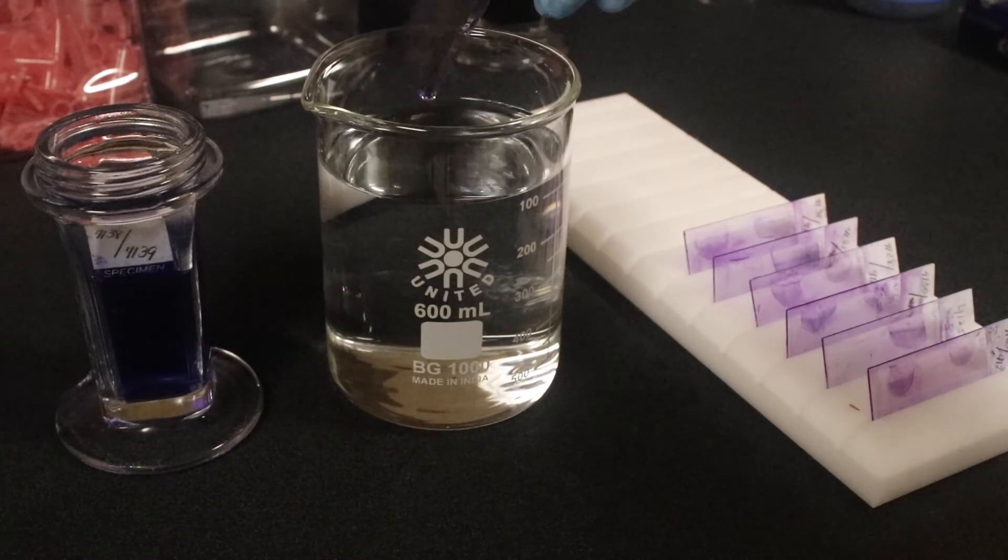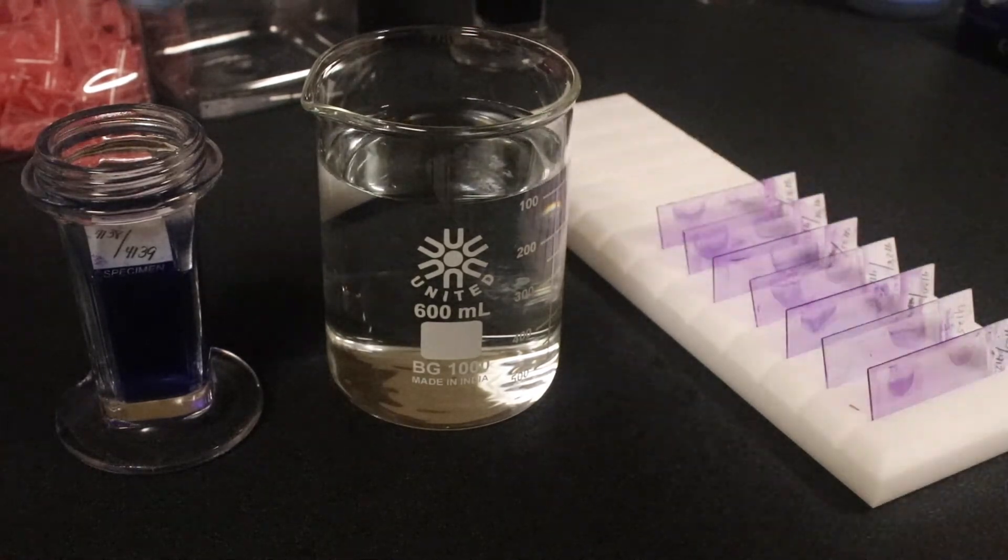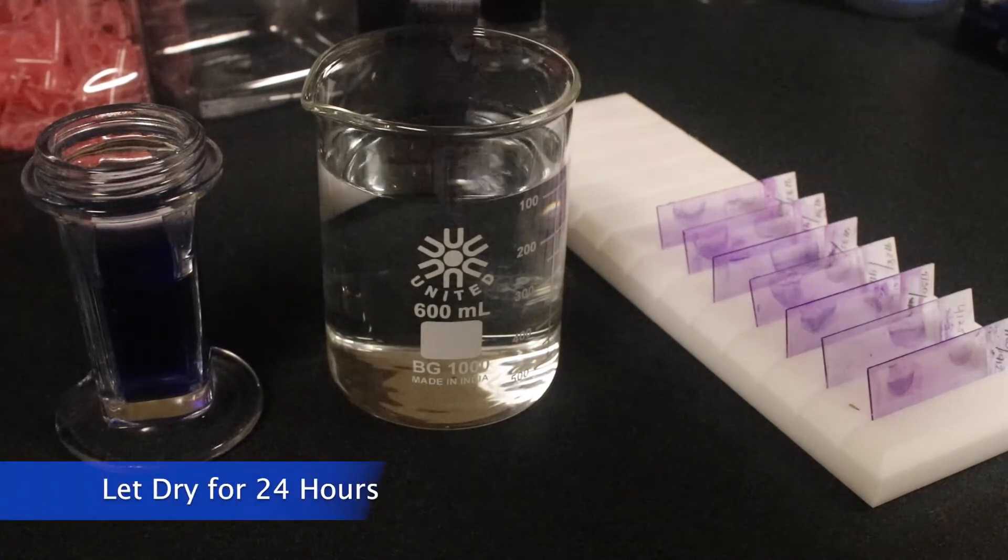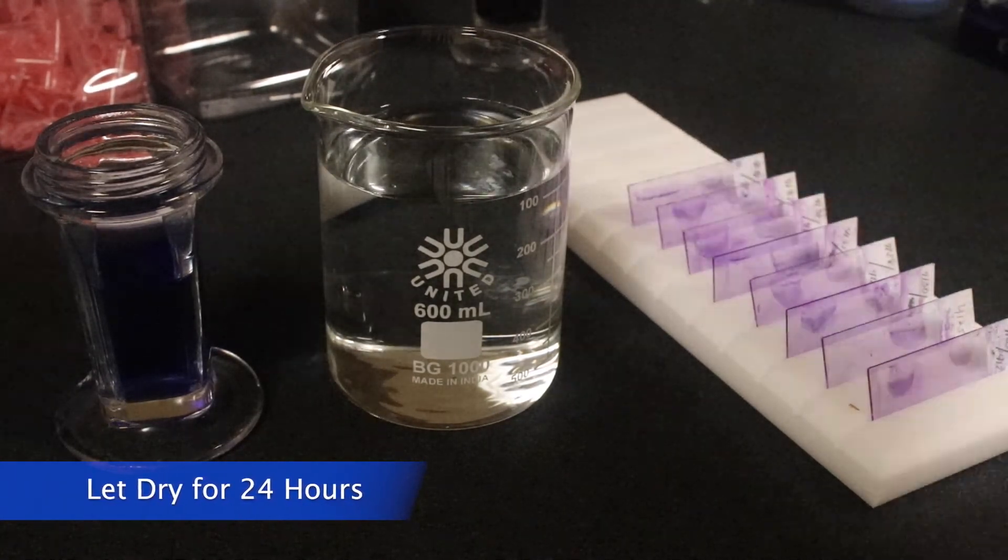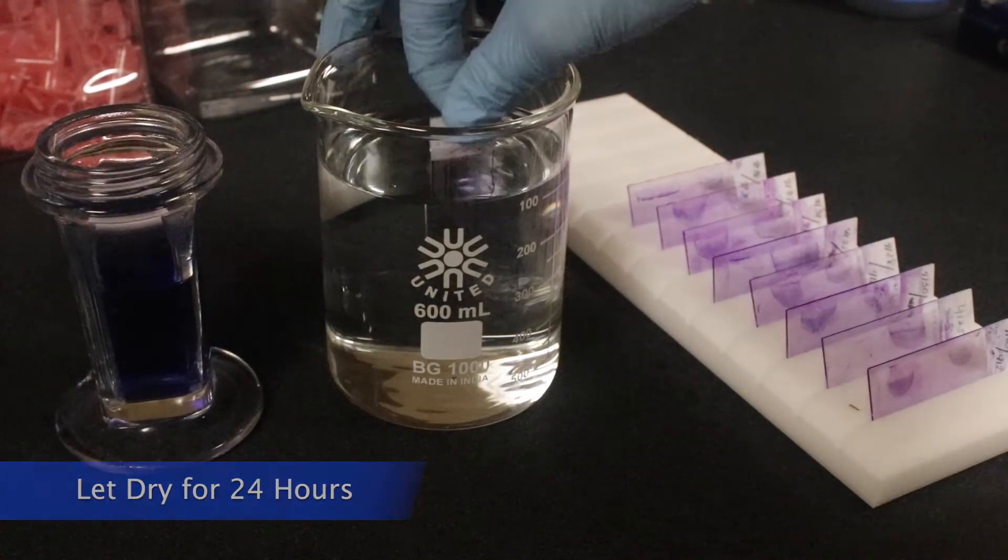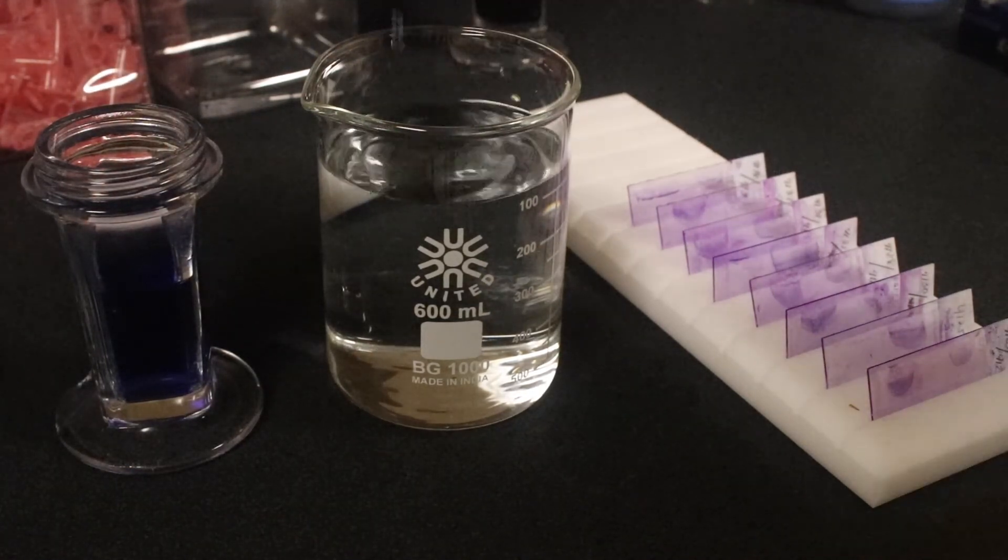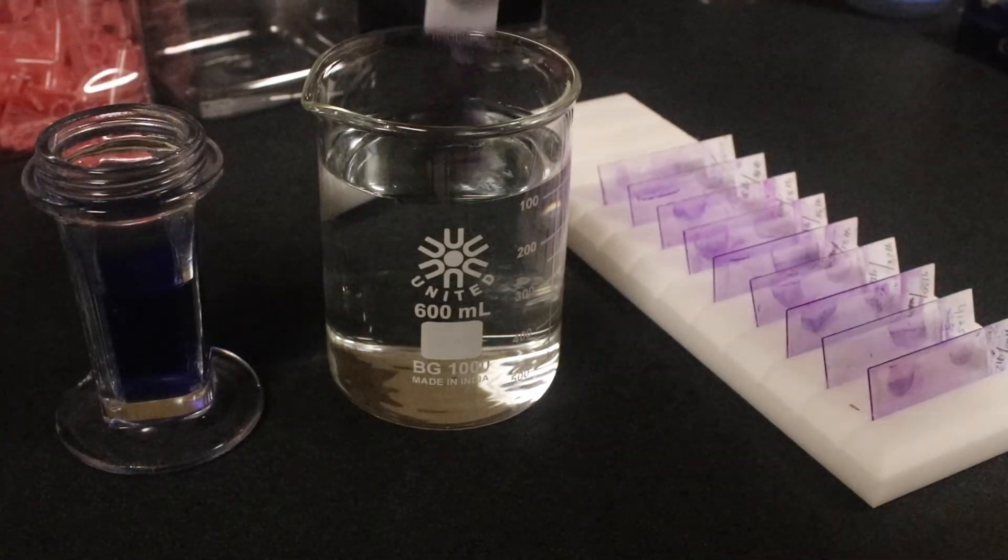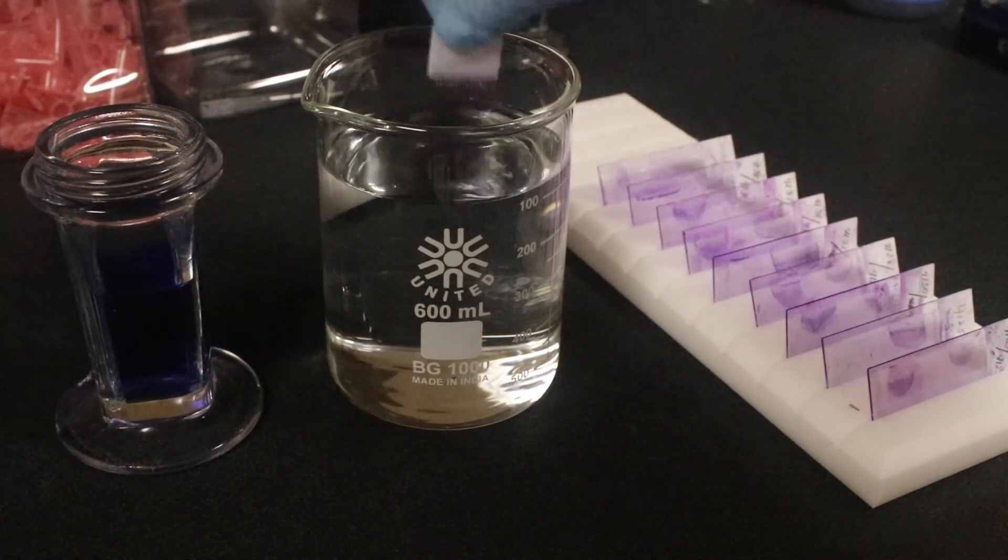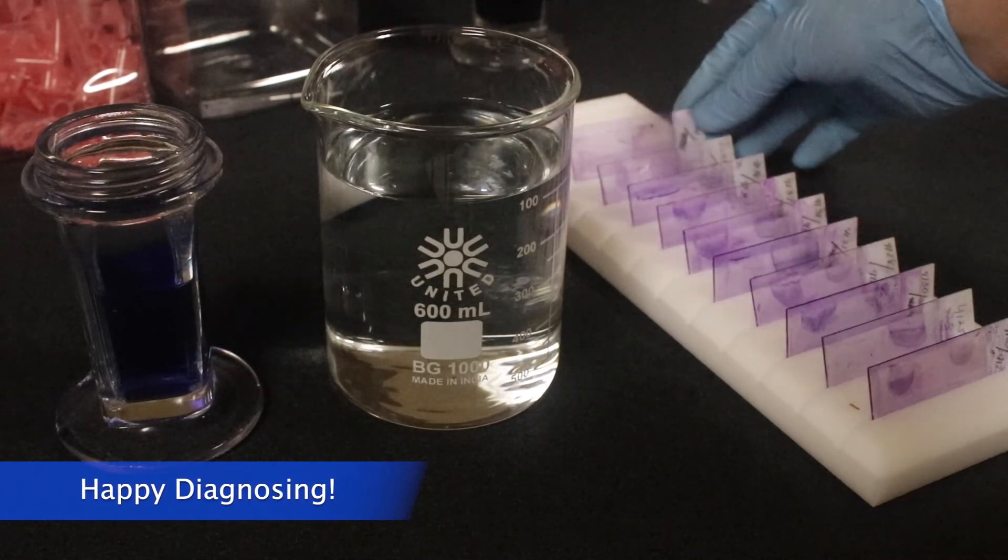And with that, we're about done here. It's probably safe to leave them dry for 24 hours to get that excess water off before we can look at them in the microscope and add that immersion oil. Hope this was simple enough and happy diagnosing.